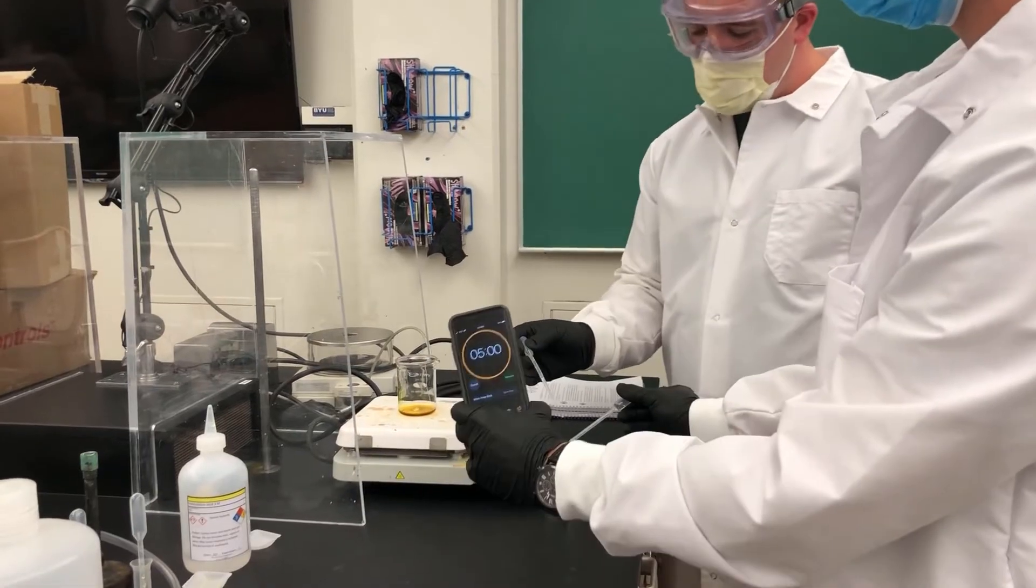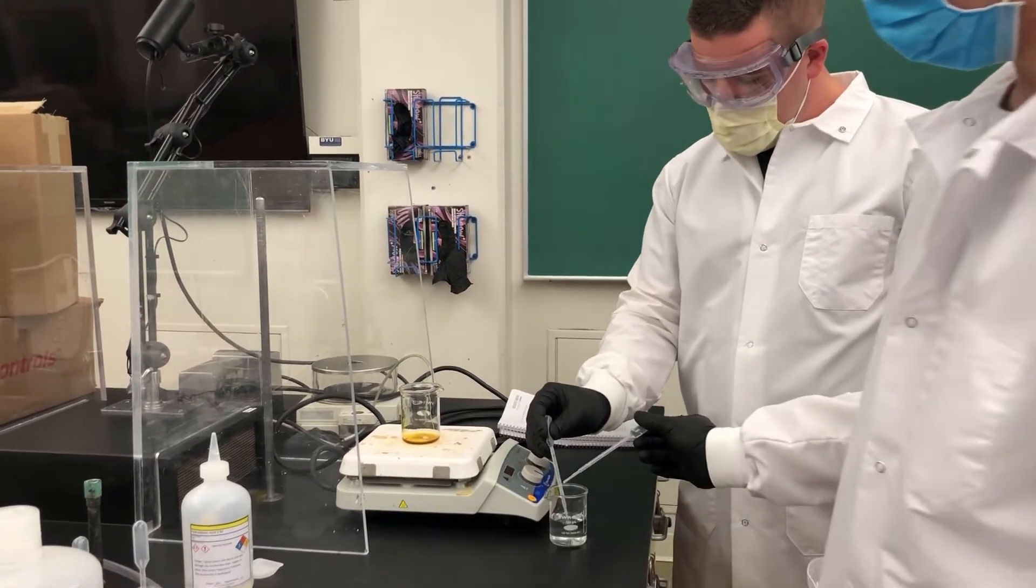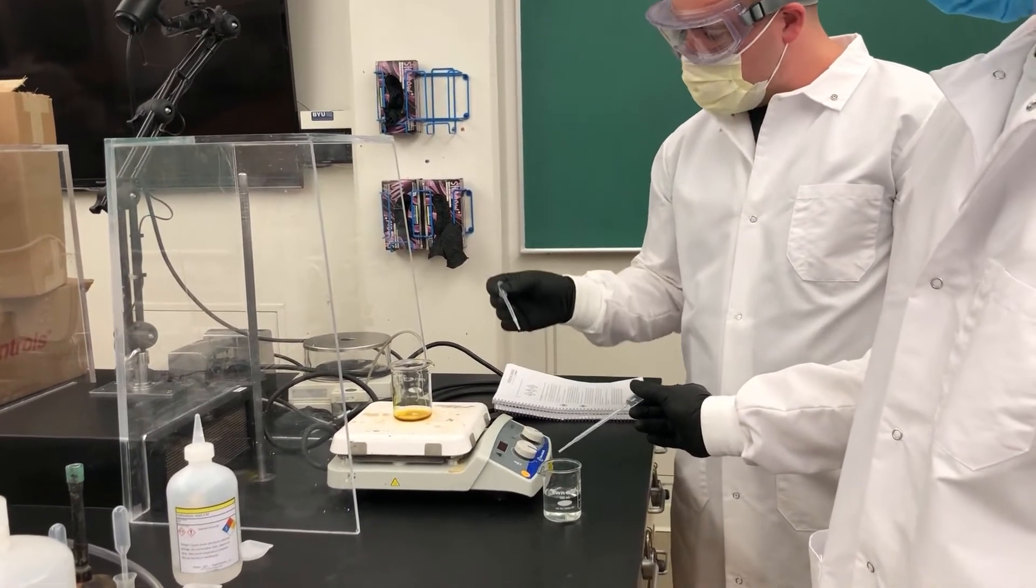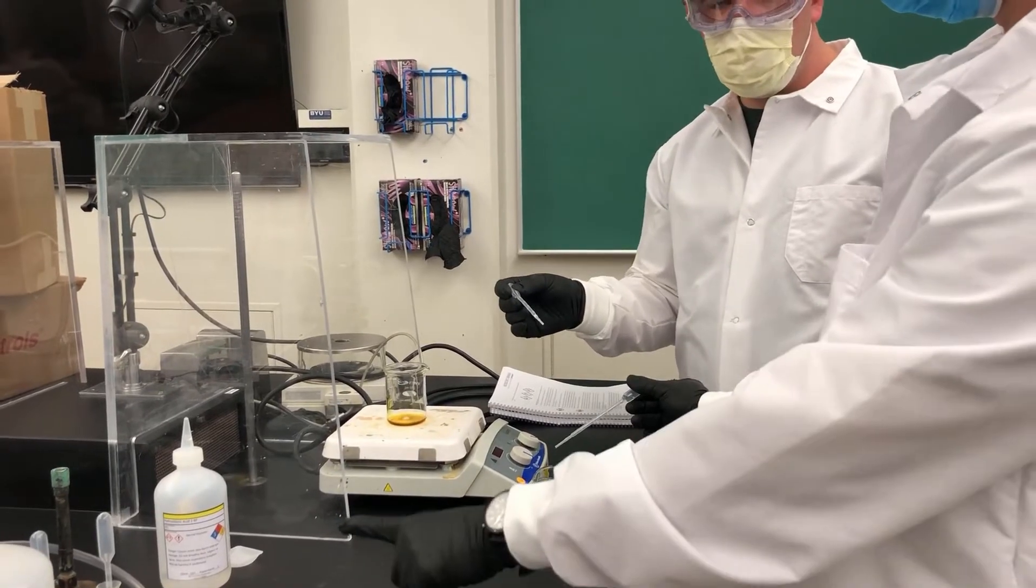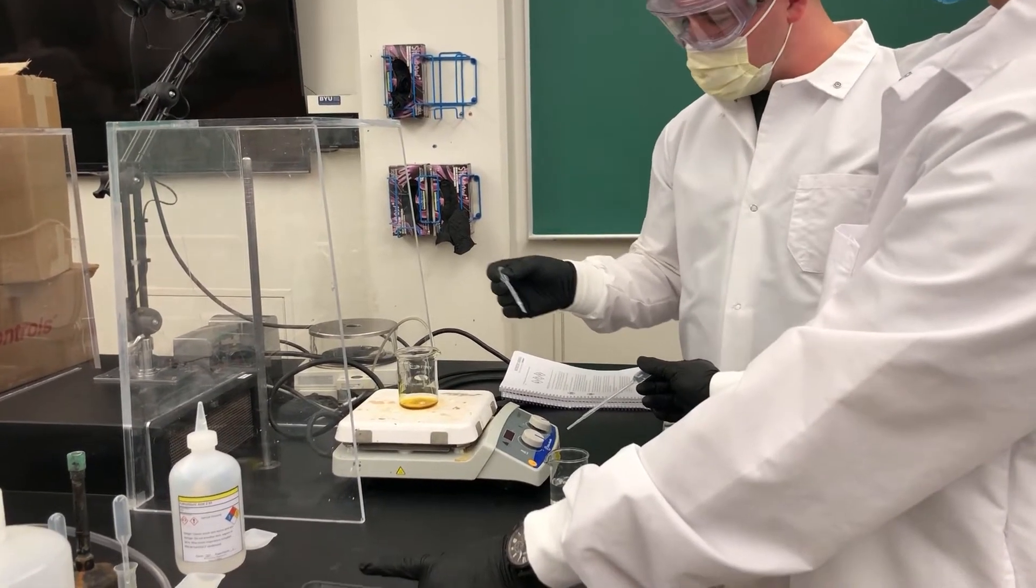So we've got our timer ready to go. We've got both of us going at a good pace. So we will start that now. And then you'll see the results soon.